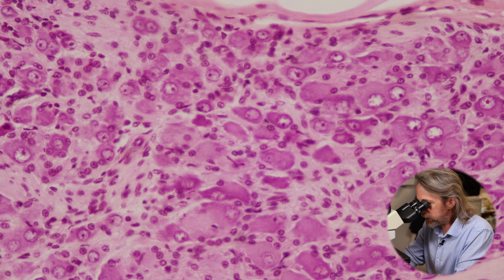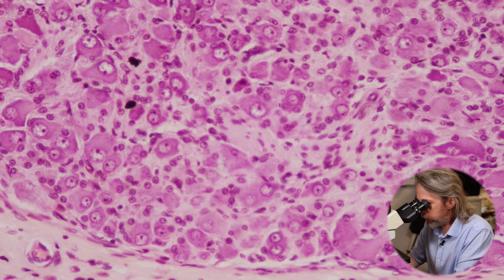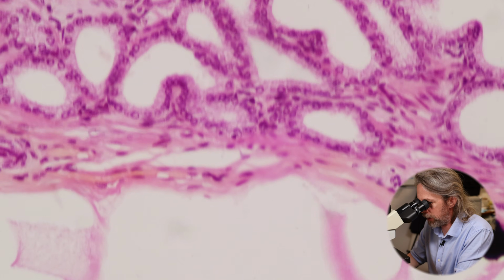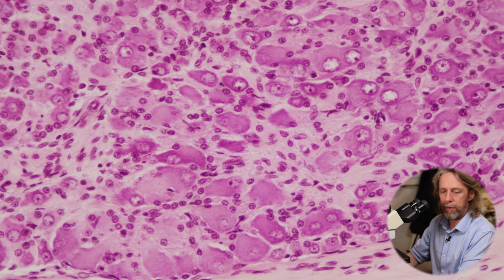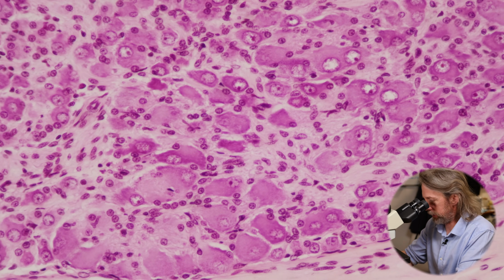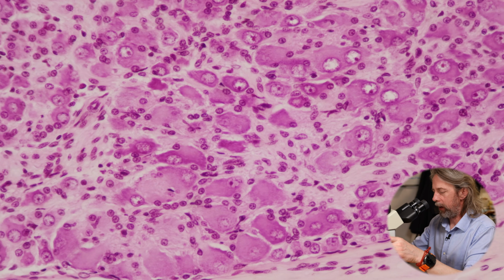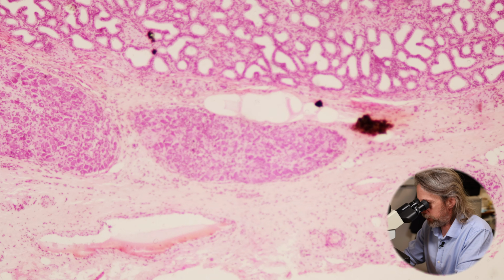What are those cells? Any ideas? Great big cells. Look how much bigger they are than the cells in the prostate. Those are neurons. This is a parasympathetic ganglion. When we talk about the anatomy here, we talk about innervation and nerves and parasympathetic stuff. Anyway, I'm not going to look at those too much because we'll get way off topic. But yeah, look. Parasympathetic ganglion, neuron cell bodies.